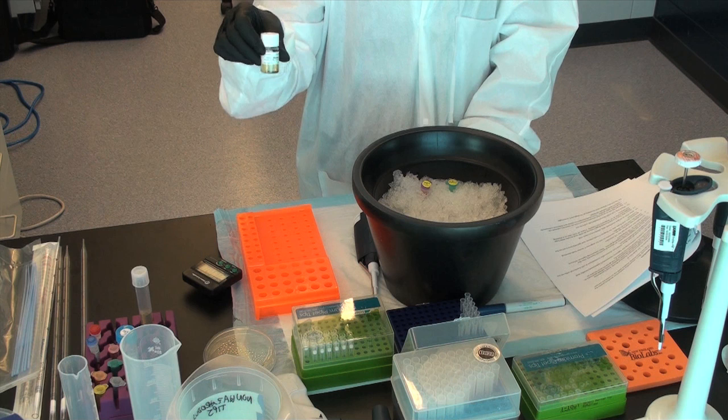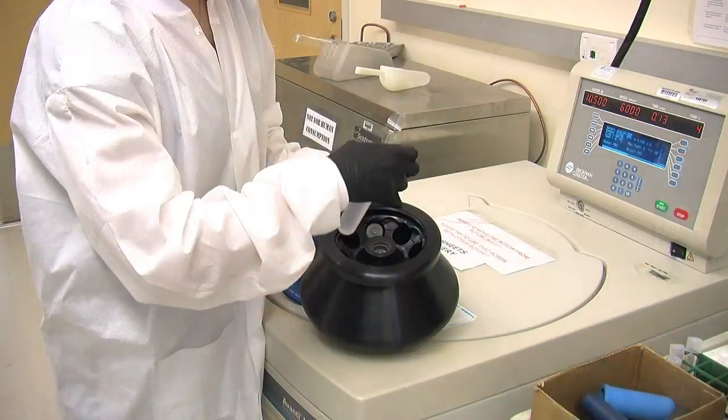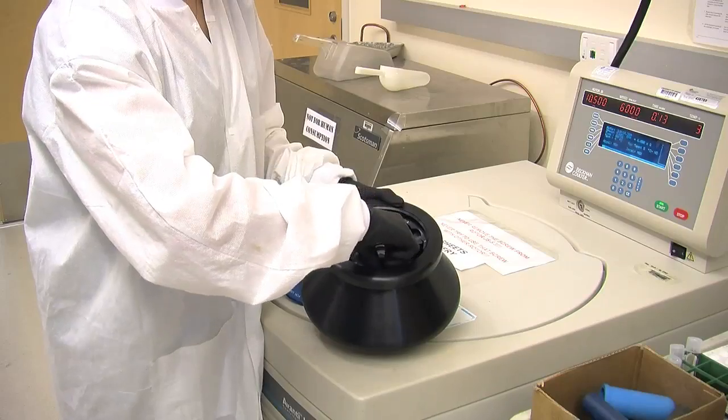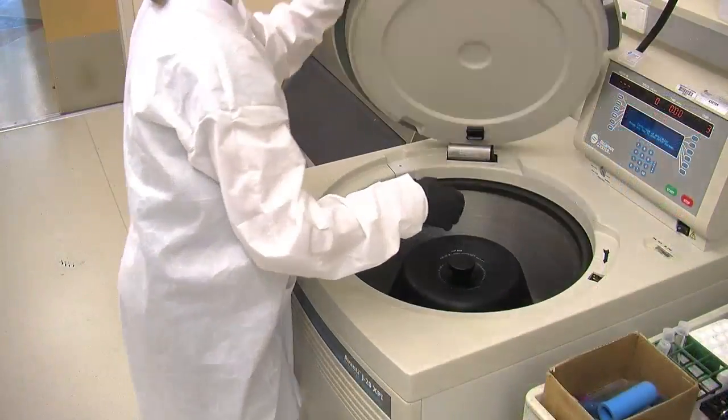SOC medium enhances E. coli growth and results in higher transformation efficiencies of plasmids. Step 4: Centrifuge the vials containing the ligation reactions plasmid briefly and place on ice.